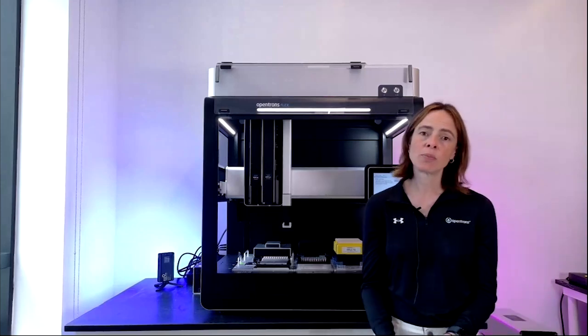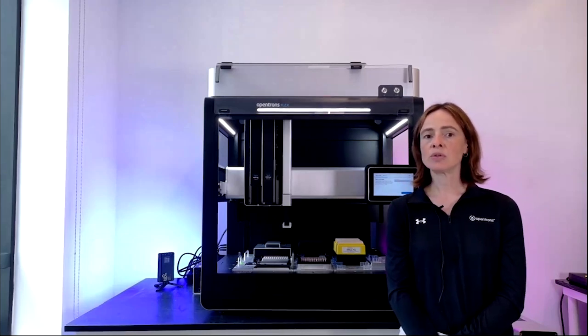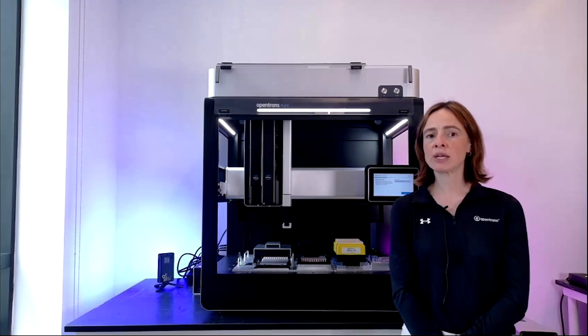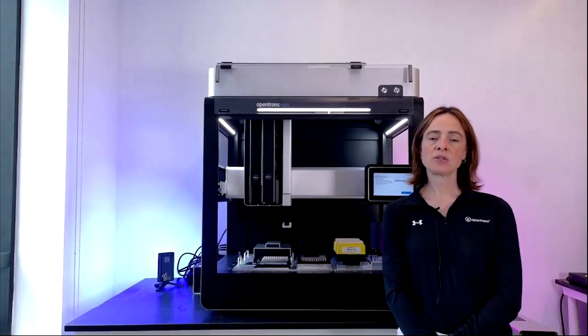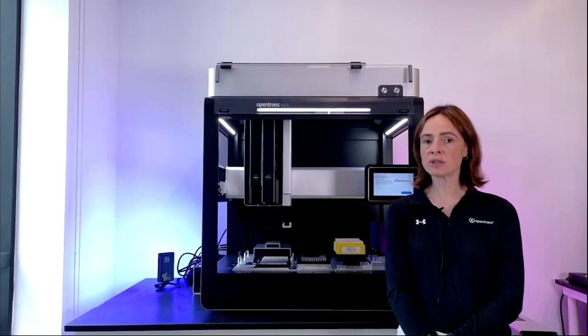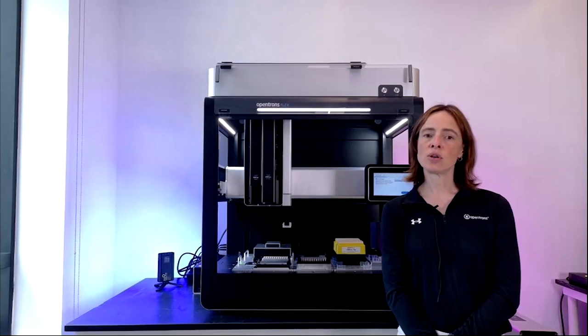And finally, I just wanted to talk about our service offerings. So we offer a white glove approach to service for our users. That includes on-site installation of the robot, training for your team, all from one of our specialized field application scientists. They also provide you with on-site support, quick turnaround time, ongoing preventative maintenance, and IQ/OQ. So we have both field application scientists to really act as your technical and application automation consultants, as well as field application engineers who are more focused on the ongoing support and PMs for your robot.